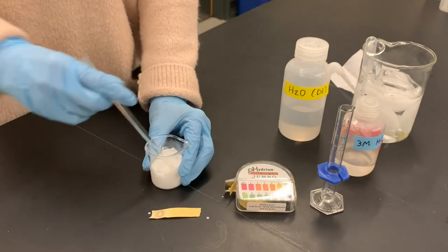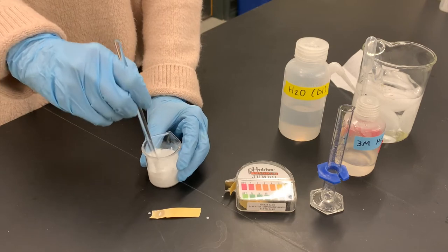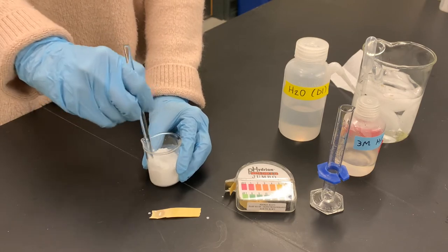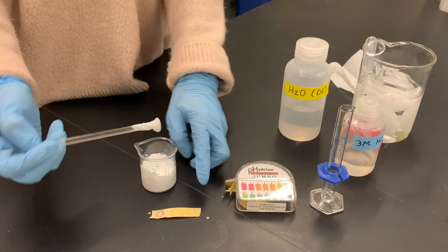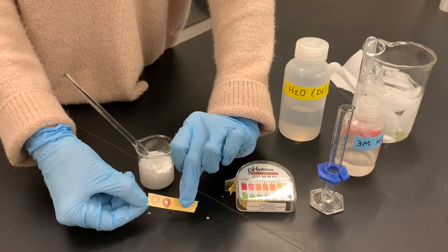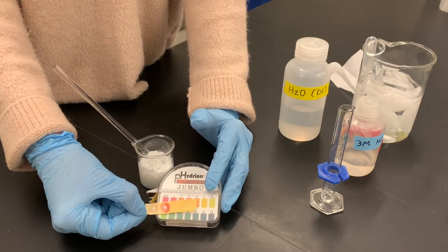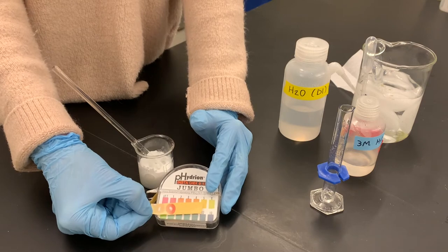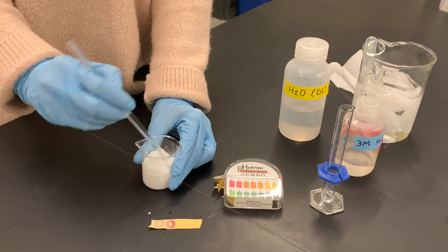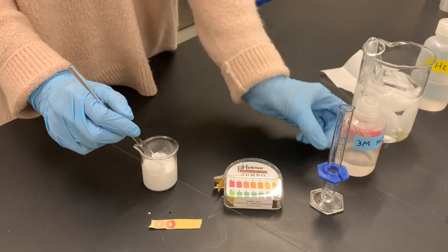At this point I've used all the hydrochloric acid the instructions said to use. If the pH isn't all the way down to two, that just means I'm going to add extra hydrochloric acid. I'm going to get that last bit mixed in and check the pH again — we're looking for a red color. Looking at the pH chart, that looks like it's around one. We've actually gone lower than two, but that's okay. We're trying to make benzoic acid, so it's okay if the pH is really low. It looks like we've gotten all of our benzoate converted to benzoic acid.